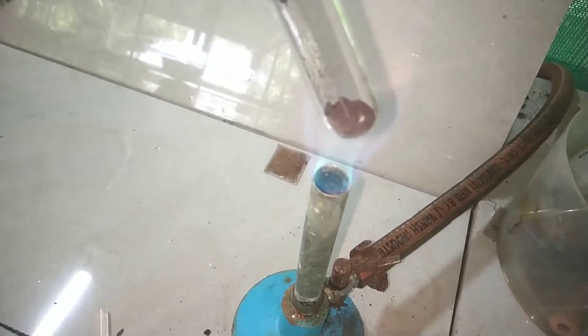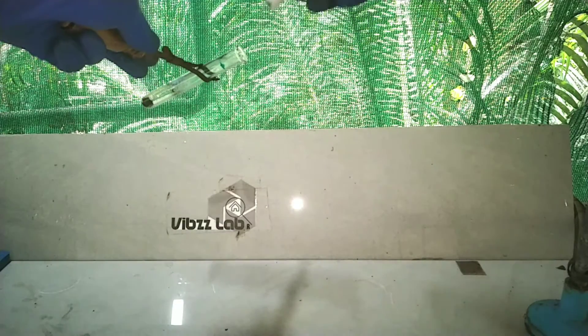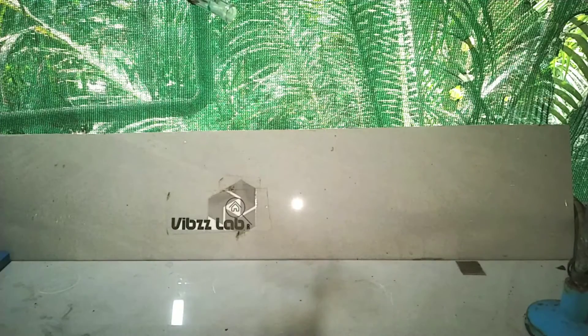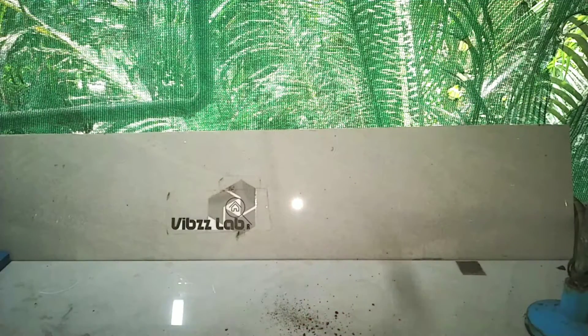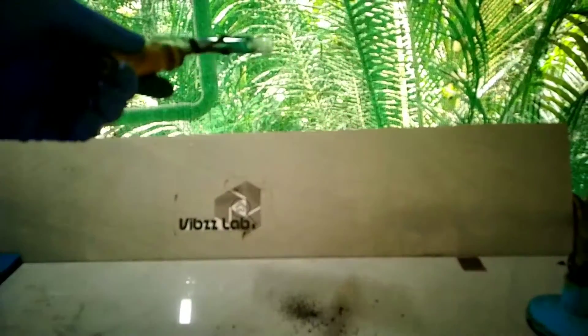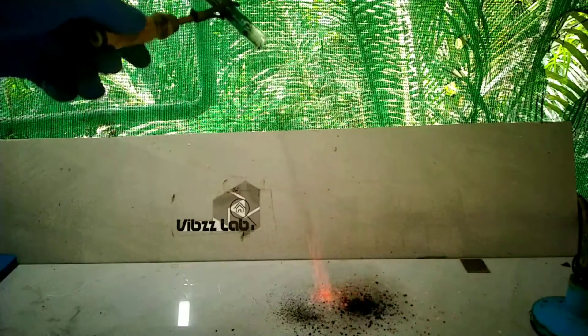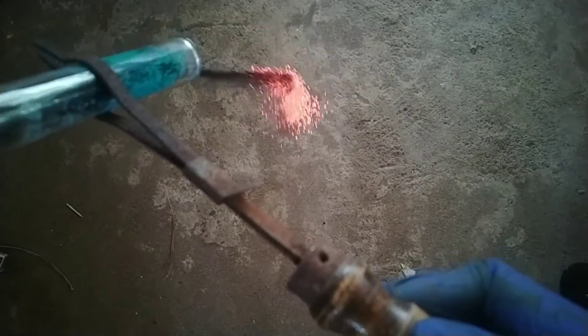Now what we do is take the test tube from the heating source, remove the cotton wool, and throw the contents down to the floor. On throwing down the contents to the floor, you immediately see the particles glowing. What is happening is the fine particles of copper are getting oxidized in the air to form copper oxide, and you can see on the ground that black powder is the copper oxide.